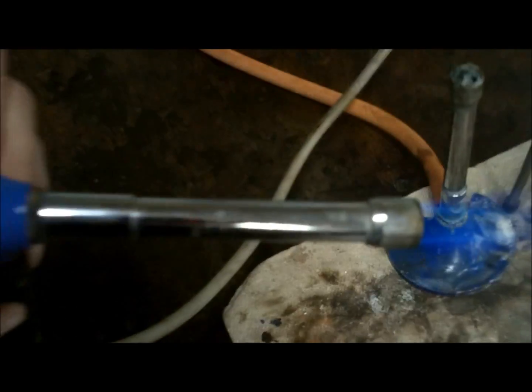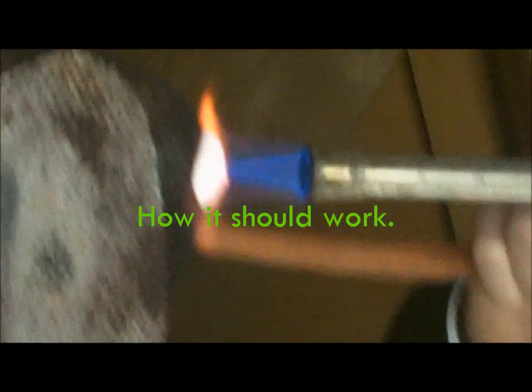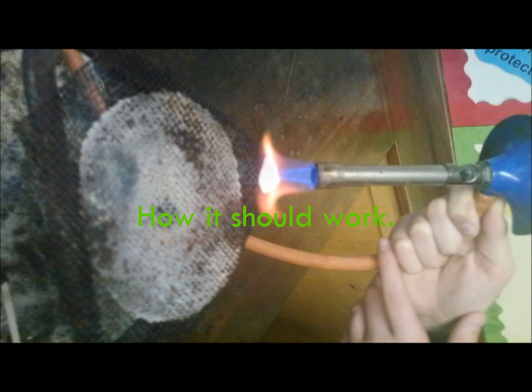Sound effects provided free, courtesy of James Campbell. Pull it back slightly. It's admirable — that is how it's meant to work. Orange glow, isn't it? It's the orange glow we're looking at. They're getting limelight! Limelight! Get it with fire. Pull it back a little — that is brilliant. We're in business.